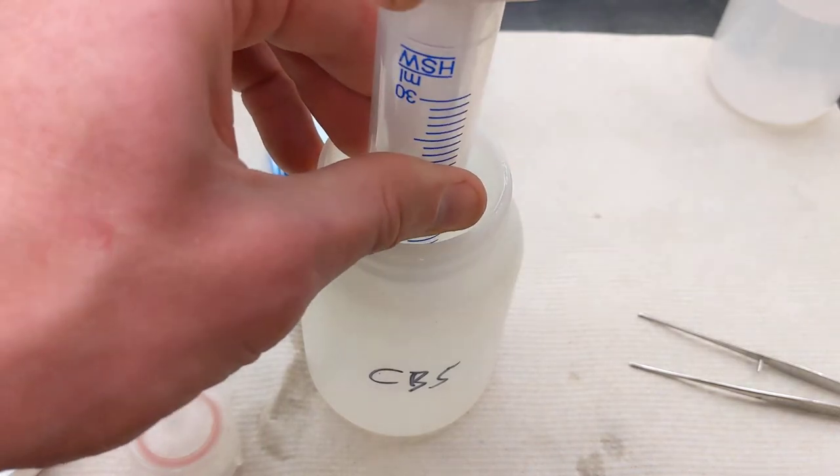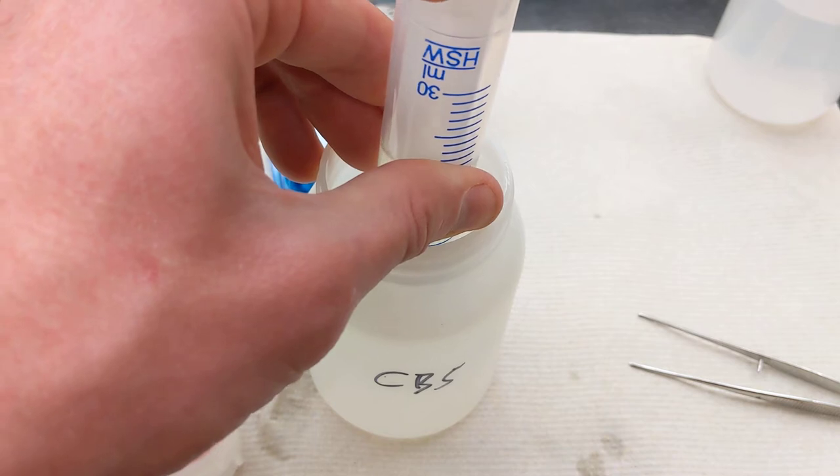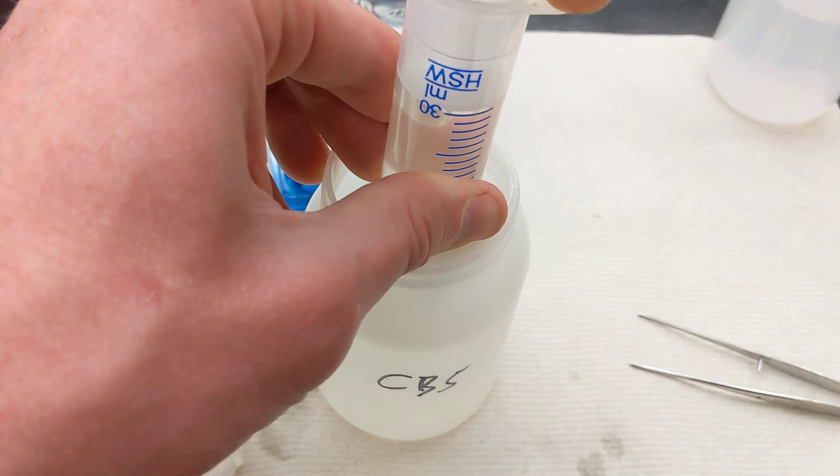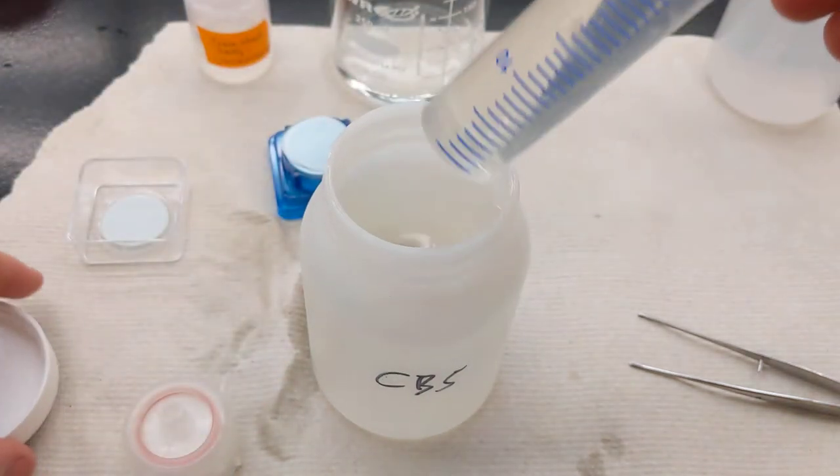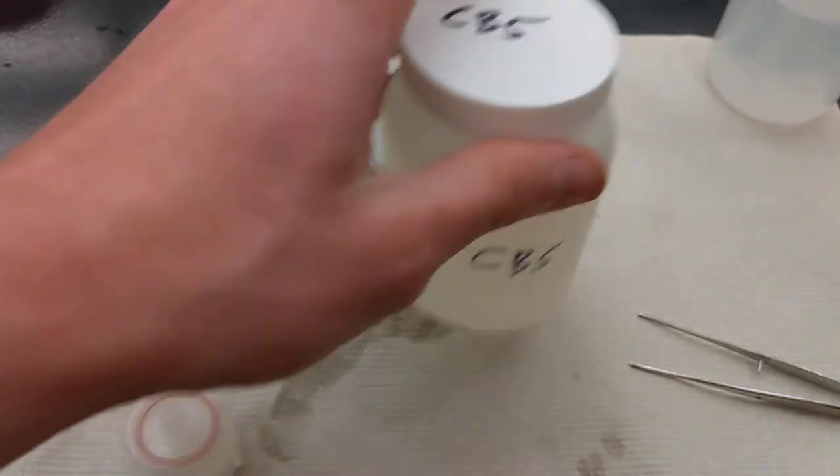Okay, one more draw of water, and now I'm going to draw in slight excess of what I want to filter. So I'm trying to filter into 15 milliliter falcon tubes to run ICP. So I'm going to pull up a full 30 here. You may not need that full 30, but if you leak, then you will.